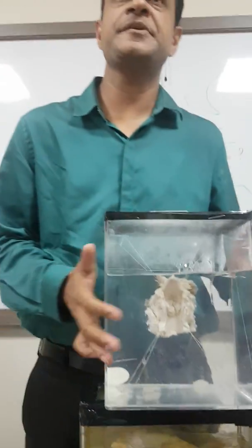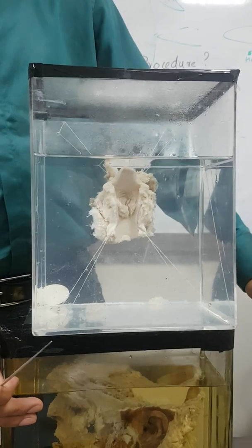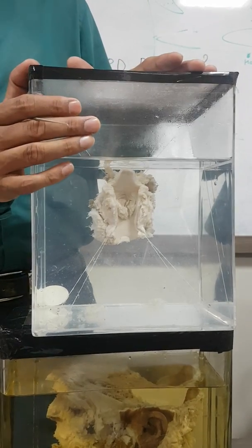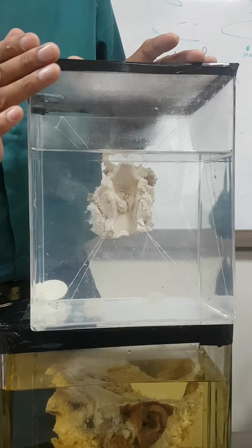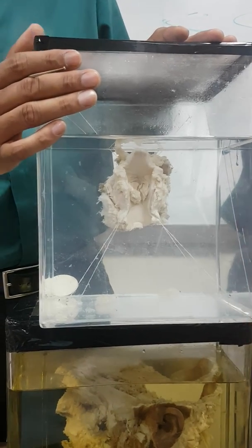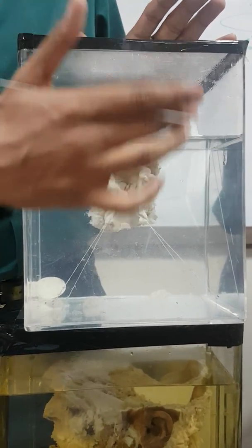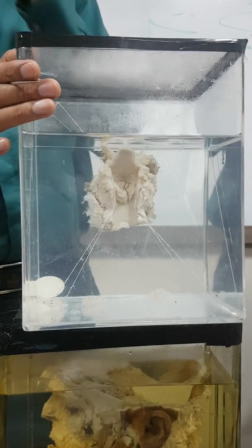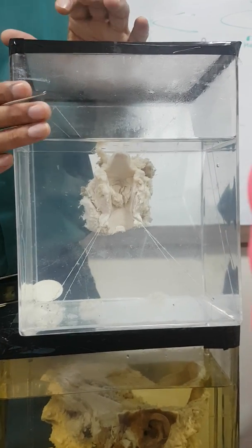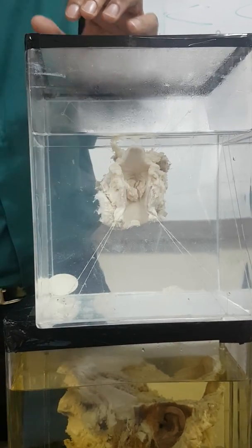The third specimen - the previous two were post-mortem specimens. This is an ante-mortem specimen: a wet mount ante-mortem specimen of total laryngectomy, where the entire larynx is taken out.